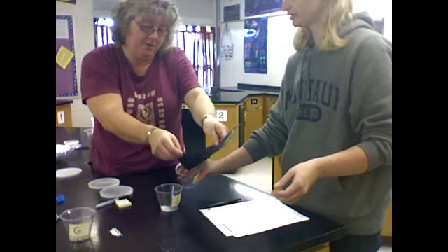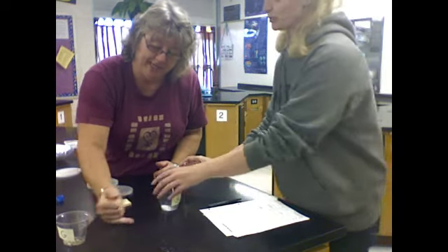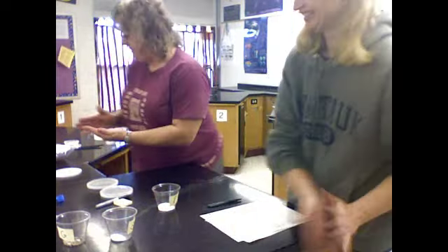Well, now that it's been on the lab table, it's probably a little contaminated with gosh only knows what else. And we have to be careful about contamination in the lab. Yes, that's why we don't eat or drink in the lab. No food or drink in the labs ever.